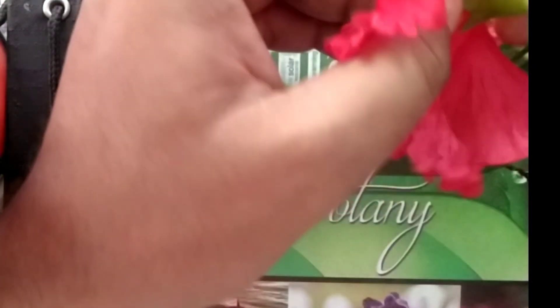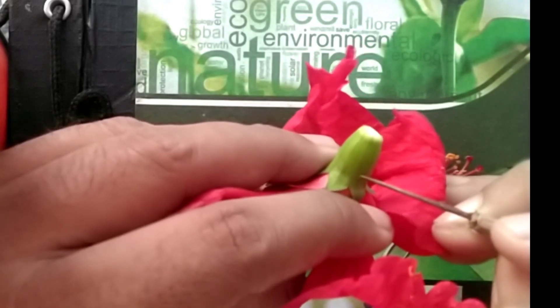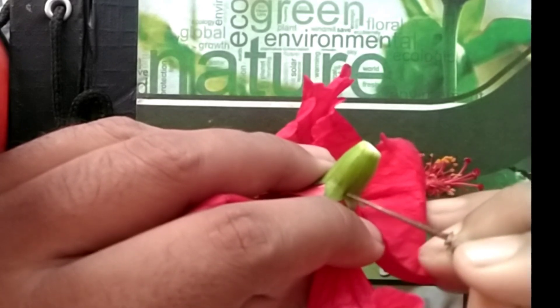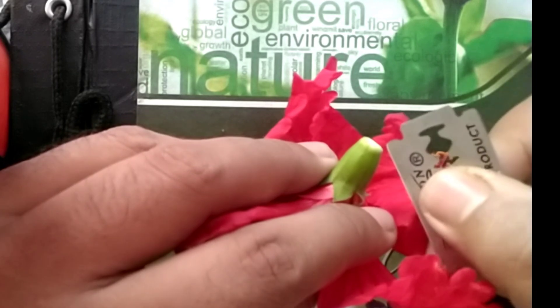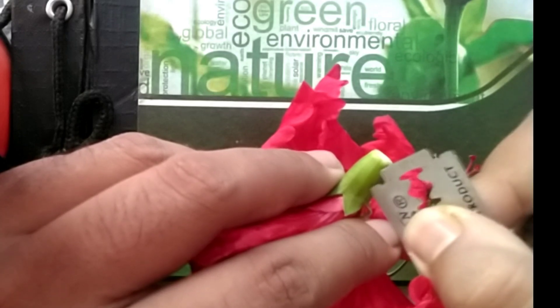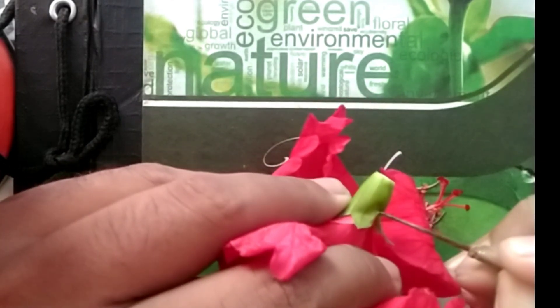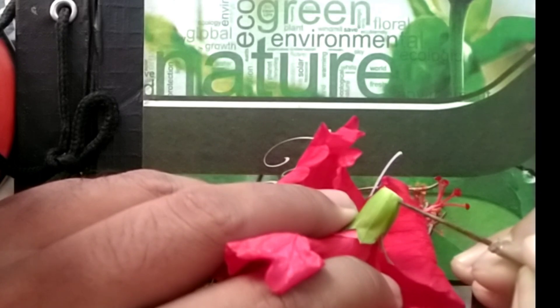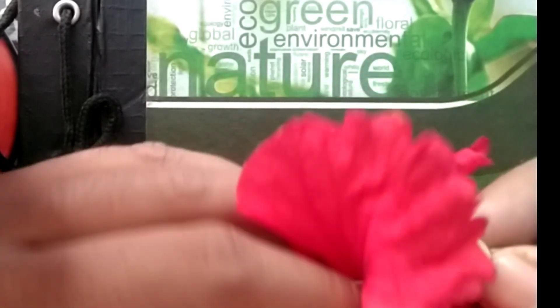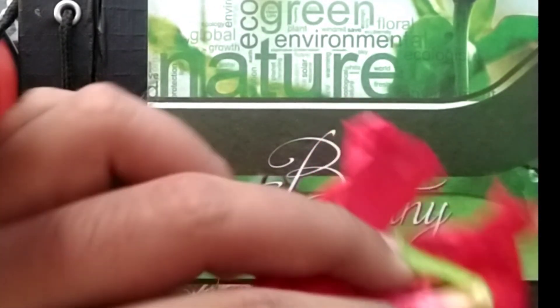Now let's move to the separation of the calyx. The calyx is the outermost part of the flower and its individual members are called sepals. I am using a needle and blade to dissect the sepals from the flower. You can see there are five sepals. You have to be very careful while separating the sepals because there is a chance they can get damaged while removing these parts.